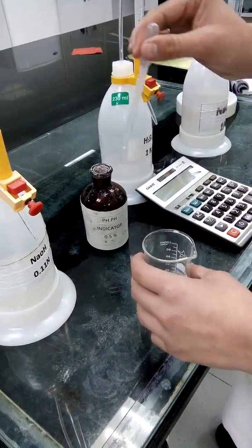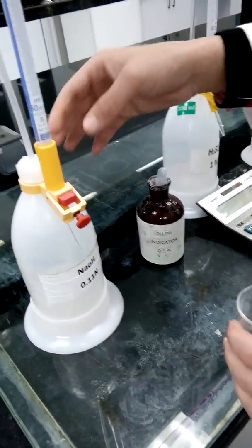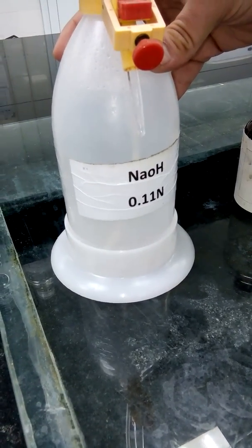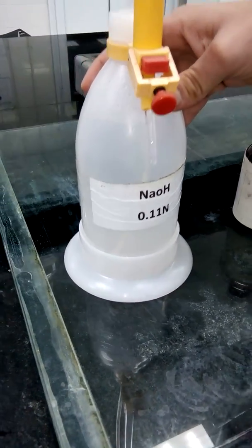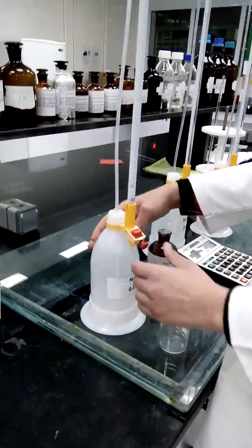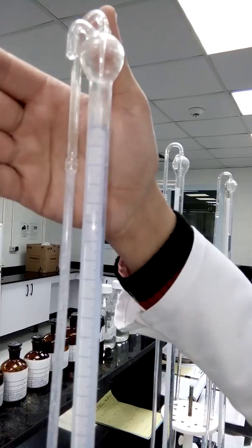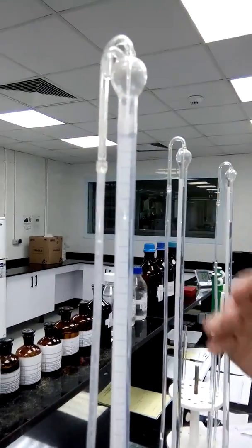And we calibrate with NaOH 0.11 normality. I have to make sure this is on the normal titrator.